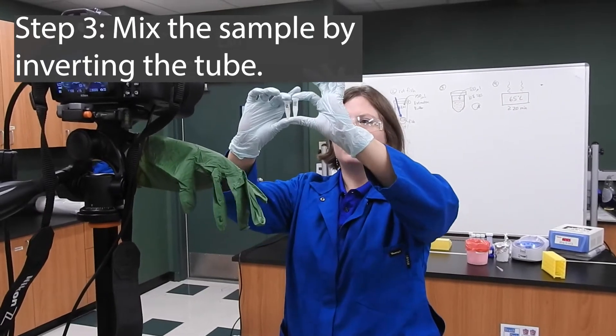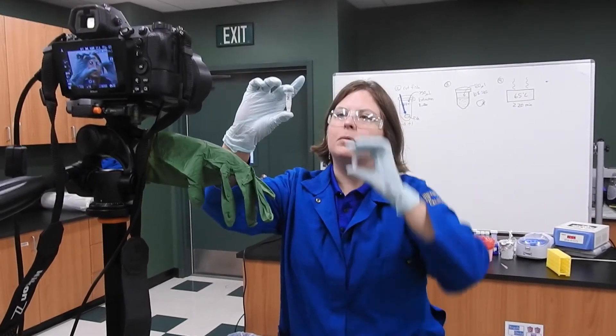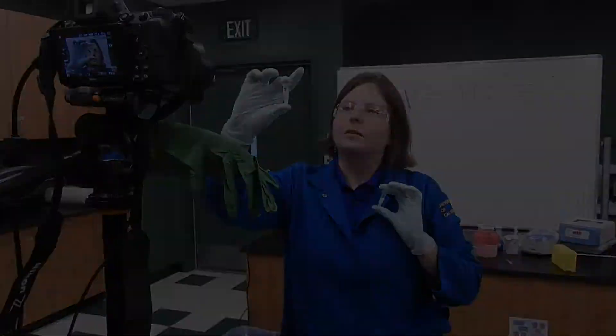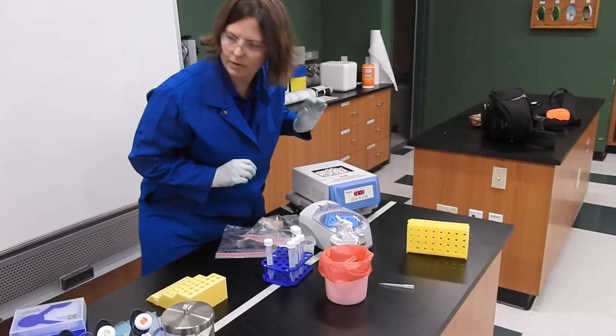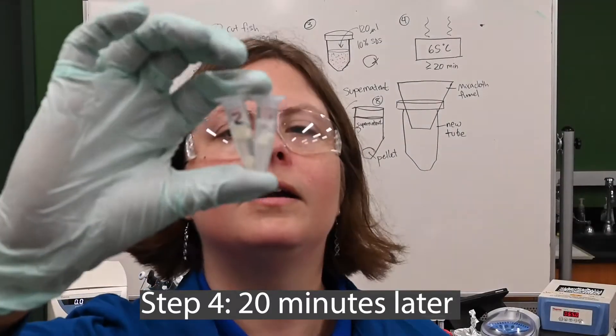So if I take this a bit, I don't know if you can see the bubbles on there. That's the SDS. That should feel pretty warm with a touch. I'll leave that at 65. That's really chunky.